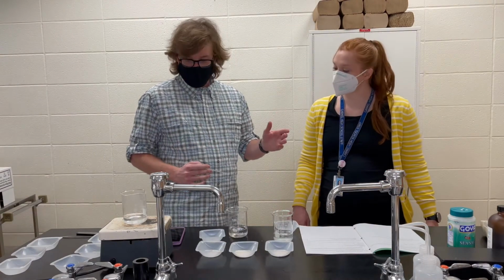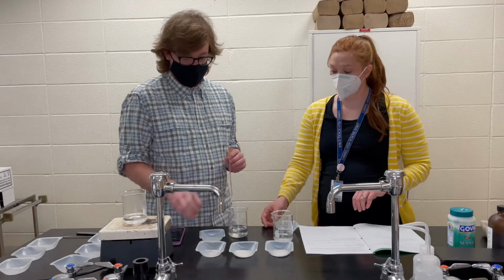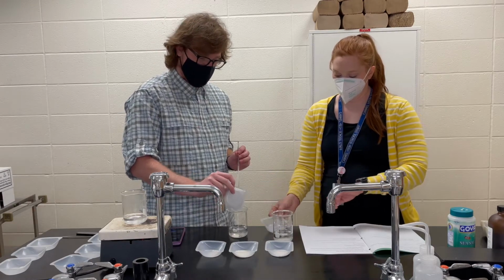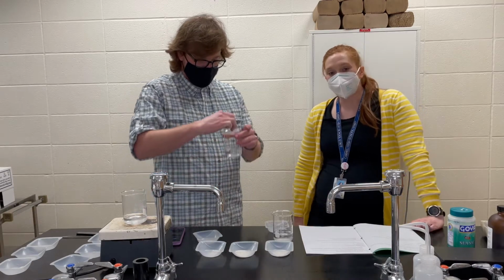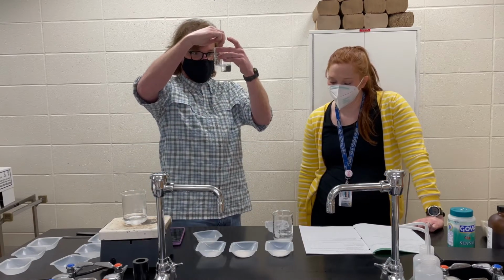So Mrs. Kat's got her own stopwatch to keep track of her time. I've got mine to keep track of mine. Okay. We're just gonna try to knock both of these out. Ready? So go. Okay. And I will be stirring the entire time, easy job, until I can't see any more salt.